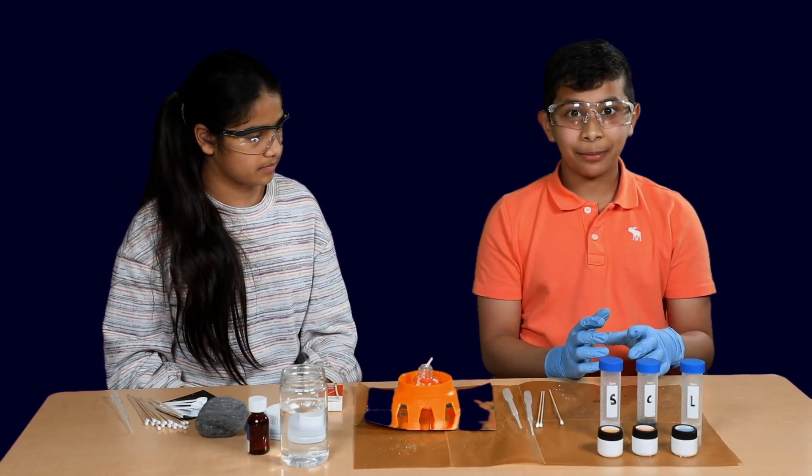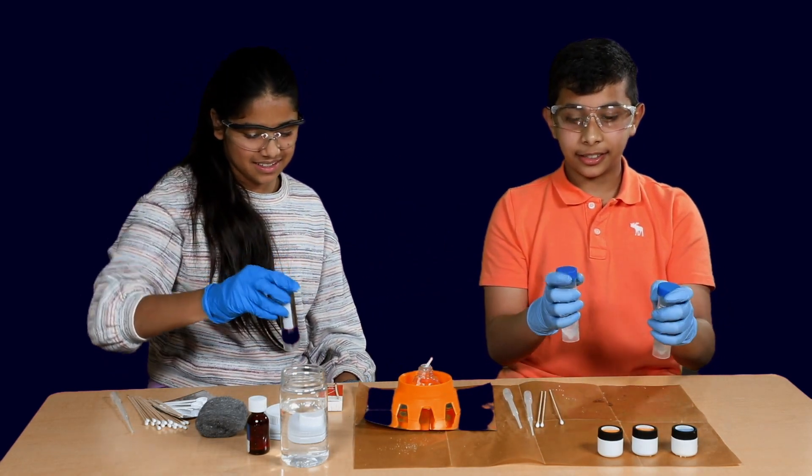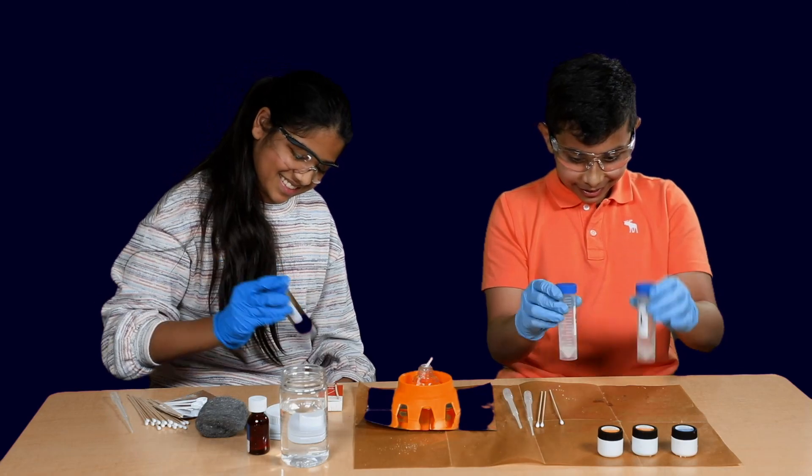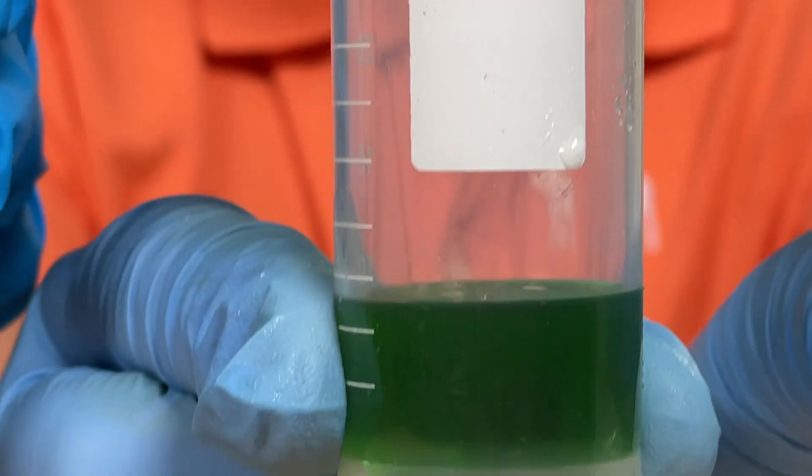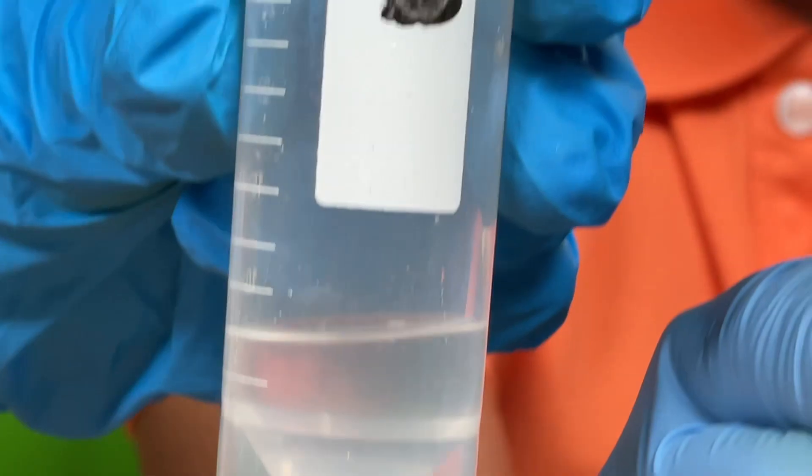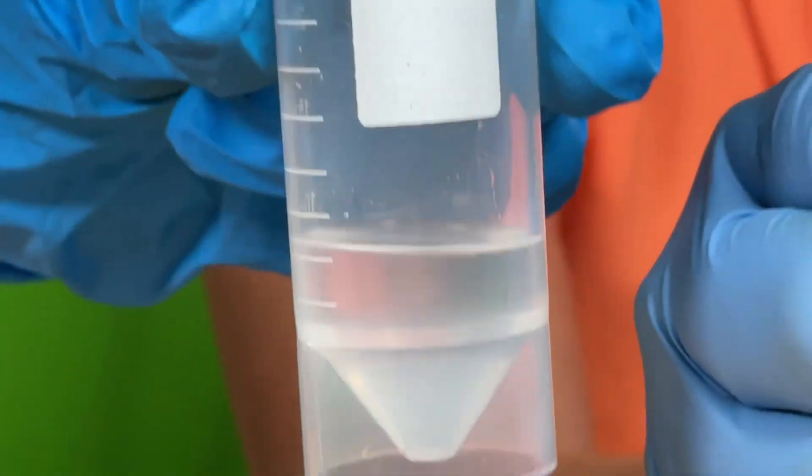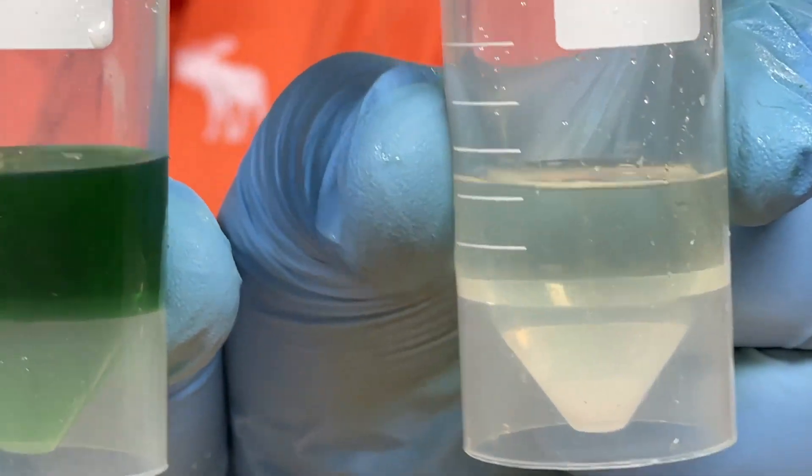Now, it's time for the best part. We have to shake the bottles. Okay, you shake that one and I'll shake these two. Shake, shake, shake. This is very satisfying. So, I can see that the copper chloride solution is green. It's like very green. And the other ones are just transparent. So, I'm very interested to see the outcome of these. So, now that we've mixed the chemicals with methanol, we're going to light them on fire and see what happens. Right. So, let's get started.